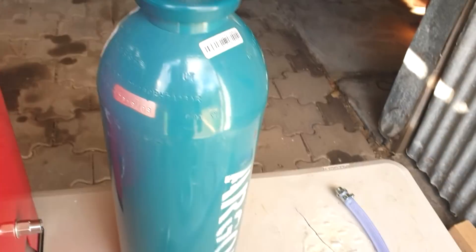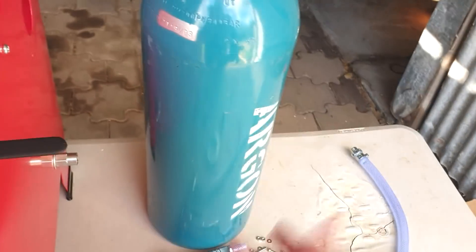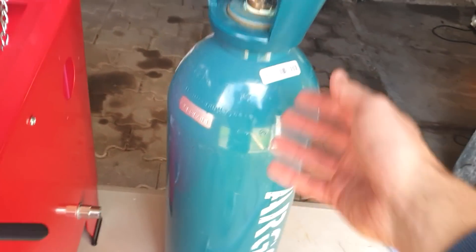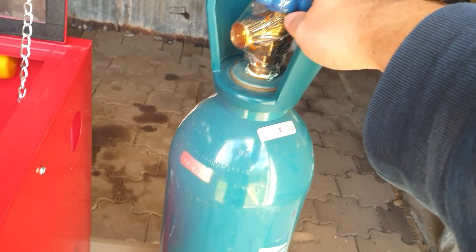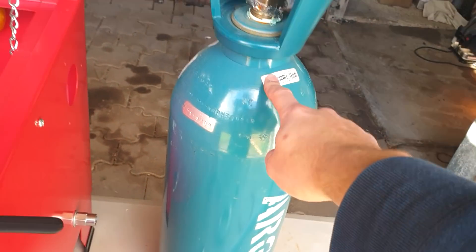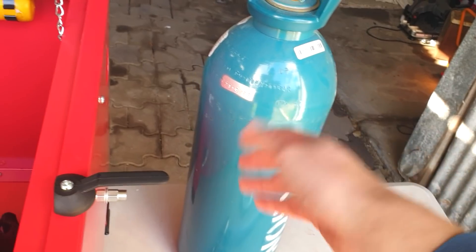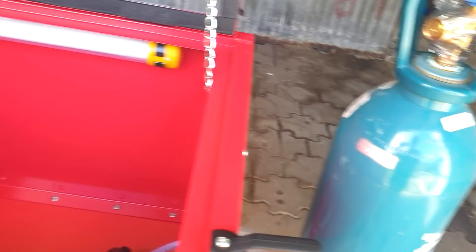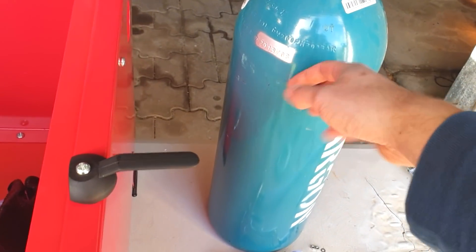This is a brand new purchase — I've finally got an argon cylinder. I ended up getting an oxygen cylinder a while back, but now we have argon. I just got a smaller one to see how we go. This cylinder was $99 plus a $200 deposit, and $99 gives us 2.1 cubic metres of gas — that's 2,100 litres of argon. This is a 90-litre container, so technically we can fill it at least 23 times. Even if we only get 10 uses out of it, it's roughly $10 a use — not dirt cheap, but affordable to do some otherwise inaccessible chemistry.